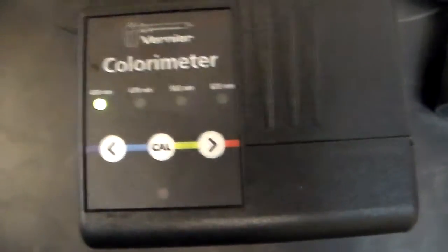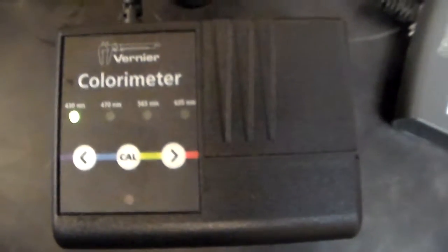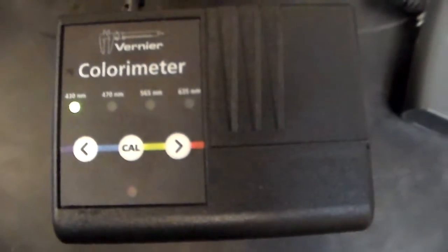How does that affect the results? CAL is the calibration. You're not going to worry about that. I get to worry about that. All right. So now you saw the basic device that we're going to use. I'm going to put this back on the mount.